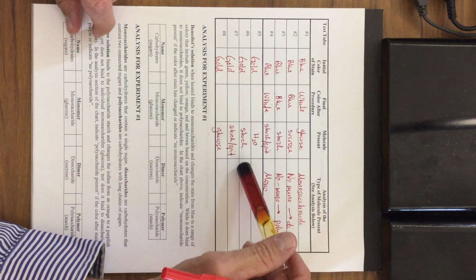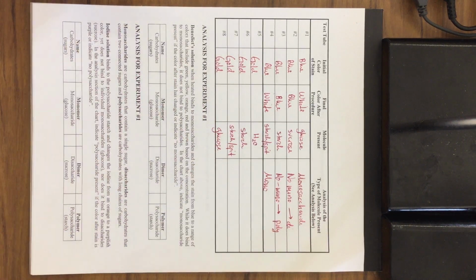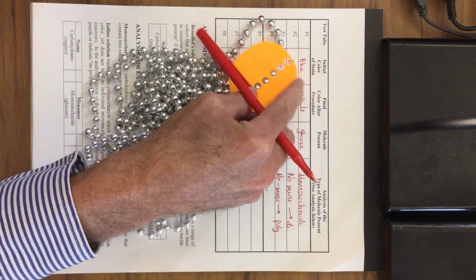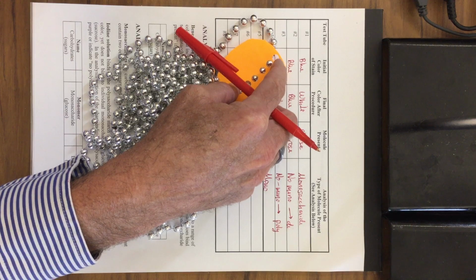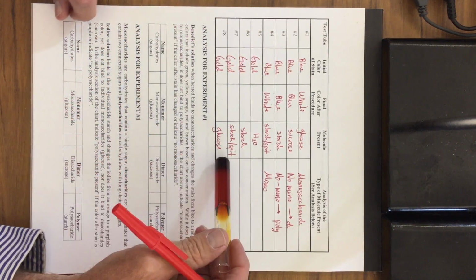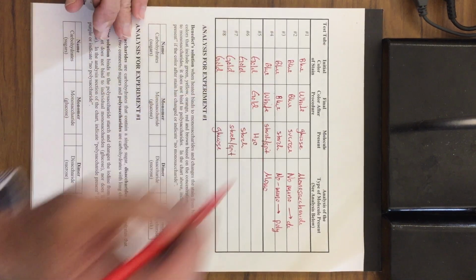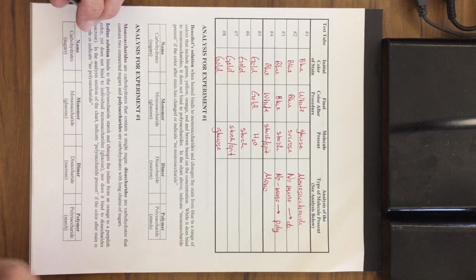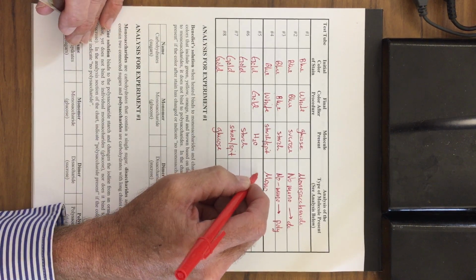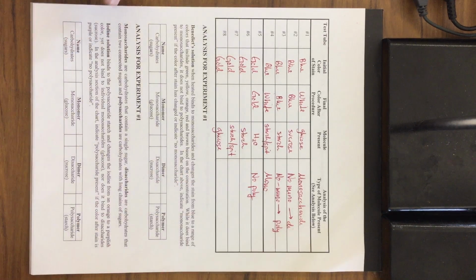And so this is the water, and the iodine is testing for a polysaccharide. So here's the orange stain. We're looking for these chains of glucoses like this, and it's going to be binding onto a polysaccharide such as starch. But there's no starch in here. So this stays gold, and this indicates a negative reaction, meaning there is no polysaccharide. So I'm going to say there's simply no polysaccharide present.